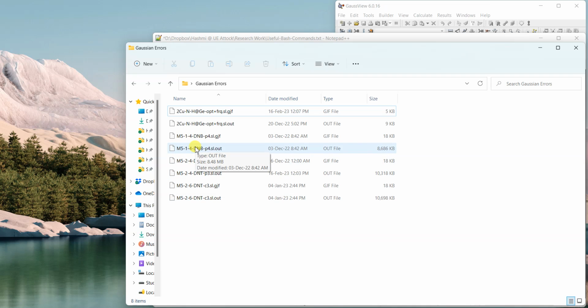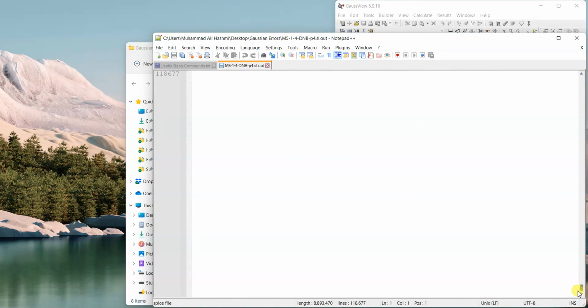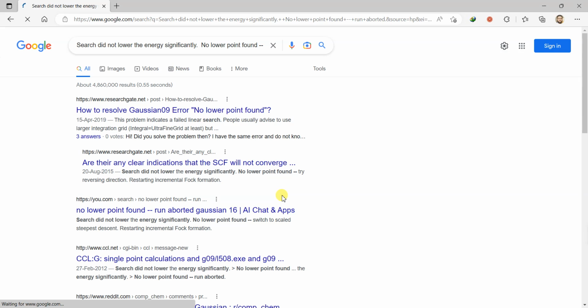So let's have a look at another file, this one over here. And if I move to the bottom of this file, you see that search did not lower the energy significantly. No lower point found, run aborted. This is quite a weird error, actually. And in such cases, I don't think that there is a really very helpful scenario. You can also go and look for such an error. Like I copy this and I Google it, I may find something useful on the internet as well. And that's really a good idea always.